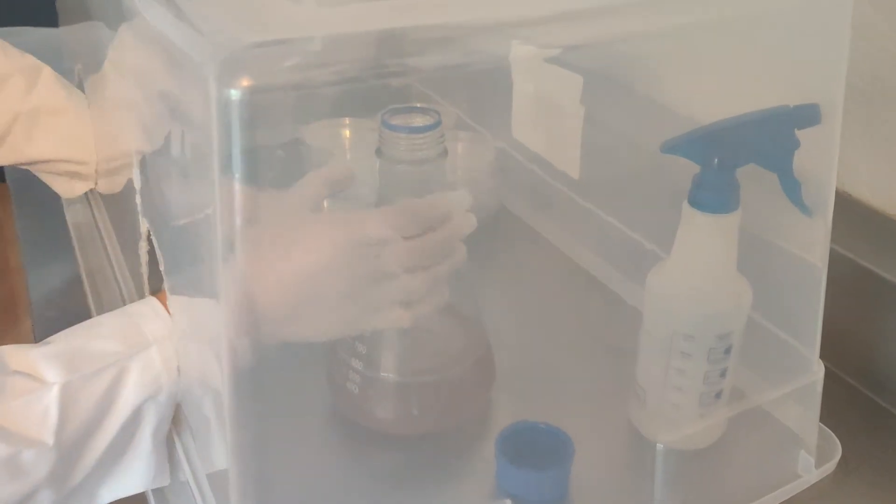The main thing you want to keep in mind here is to work quick and clean and only open up the petri dish as much as you need to. Whenever you're filling the plates, just cover the bottom and move to the next plate.